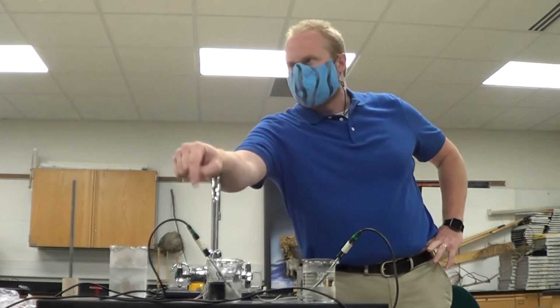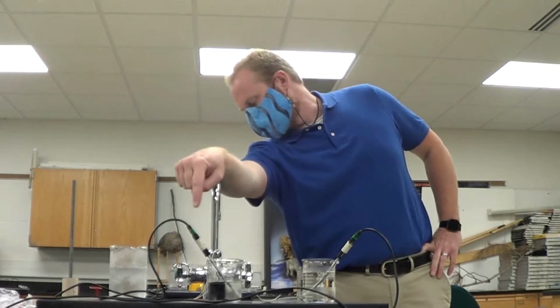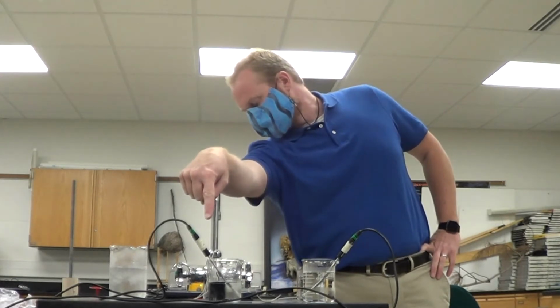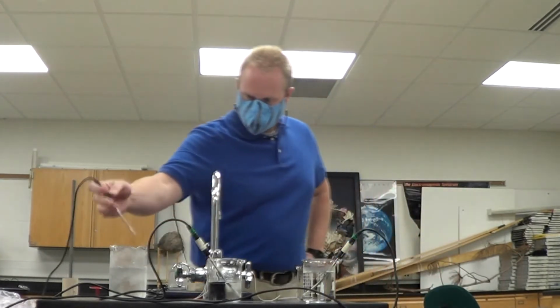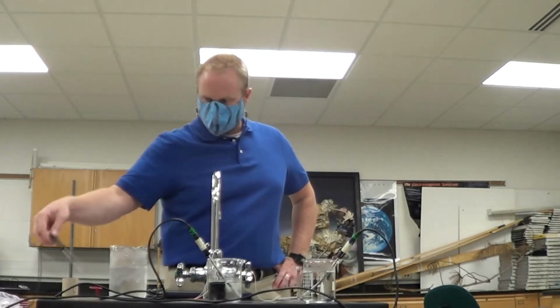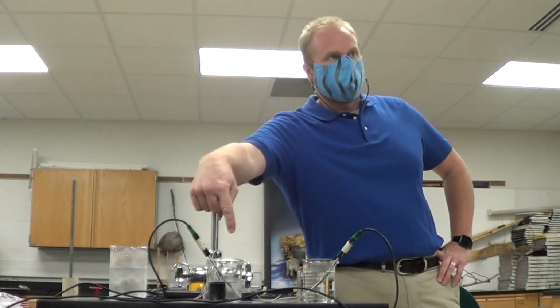Which one is this one? Is this green or was this red? Is this green or blue? That one was blue. This is the blue one. Okay, this is red. Ignore red, we don't care about red anymore. Okay, so we give it some time. This is the blue one.